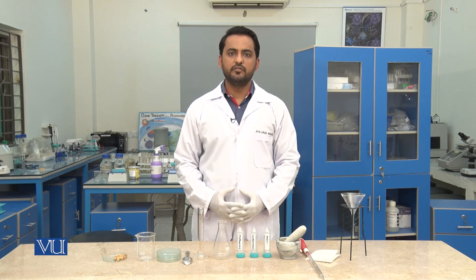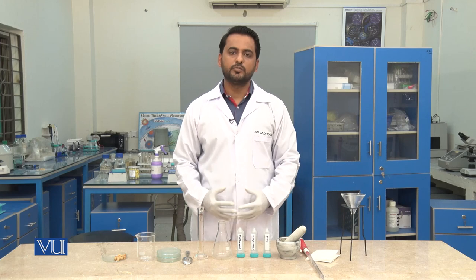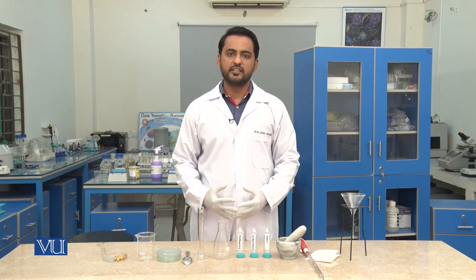The experiment we are going to perform today is regarding the extraction of lipids. Before we start, I would like to give you a brief introduction. Our food is basically divided into three major components: carbohydrates, proteins, and lipids. Carbohydrate is a quick source of energy and its metabolism is quite fast, and it is present as a major component in almost every food.